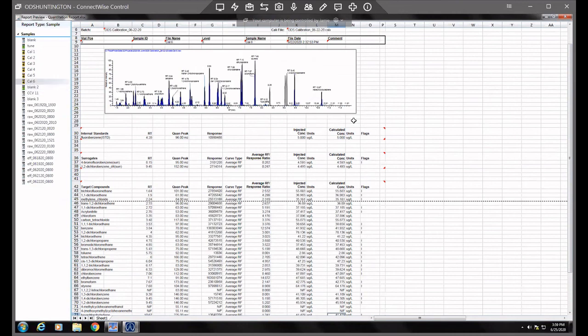So that's how you do it. You can go back through if you have more, and I would first identify and make sure you know which compound has changed retention times. If you look at the video on using your spectra to identify, you can use that to identify these compounds and make sure that you're adjusting the right retention times when you do that.